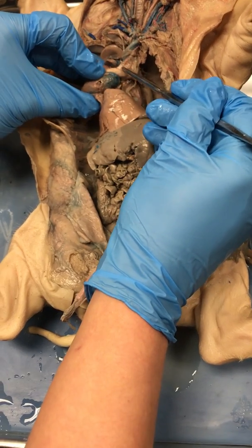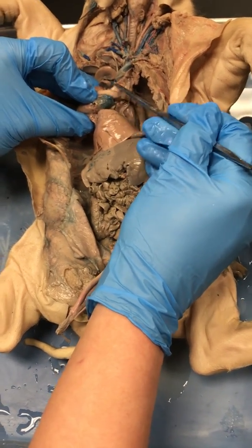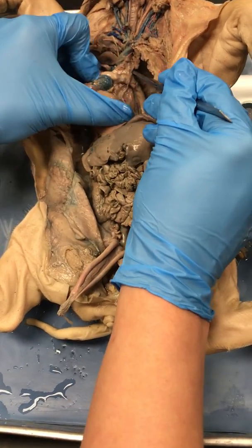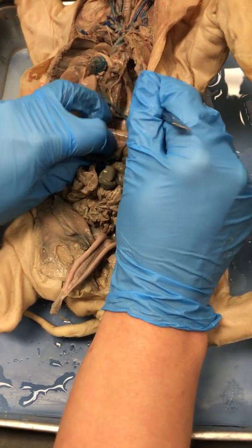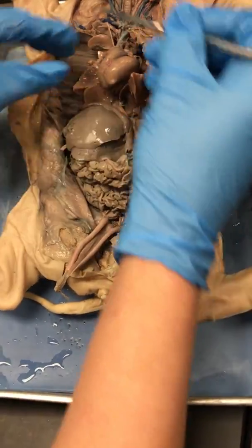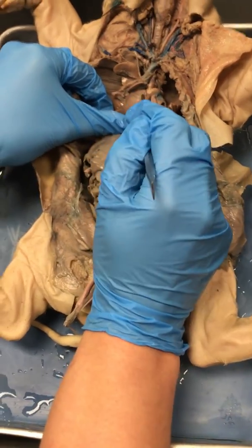Leaving the left ventricle right here is your aorta. This portion is your ascending aorta. Then you have your aortic arch, and then you dive down on the left side of the body. You've got your descending aorta. Really pretty. All right. So that goes over the heart proper.